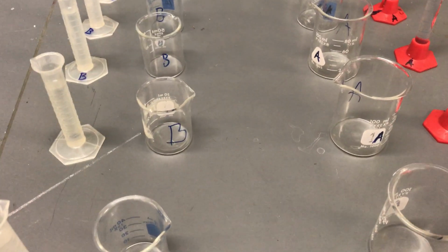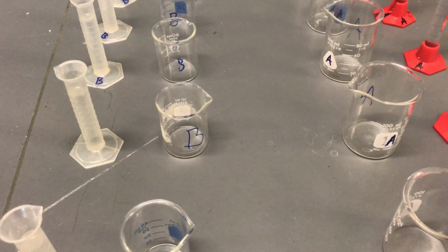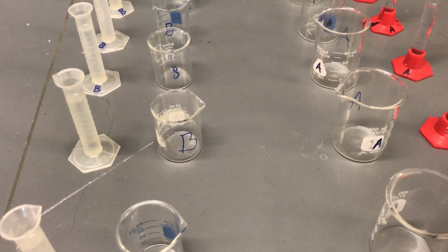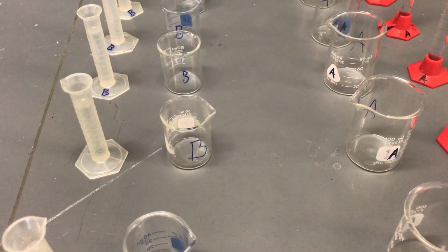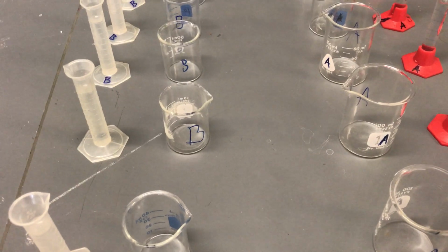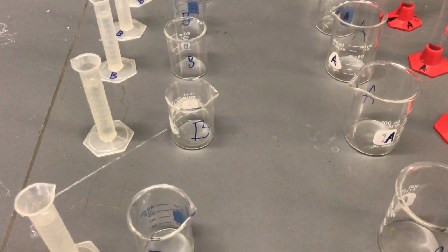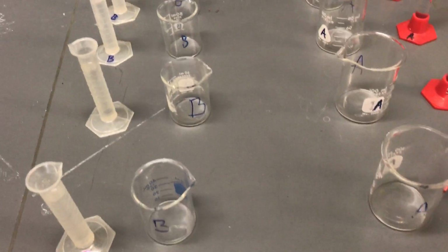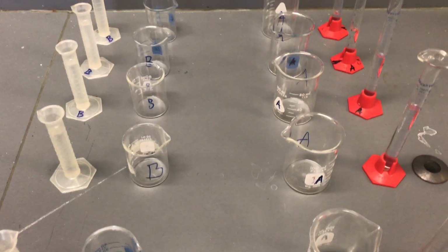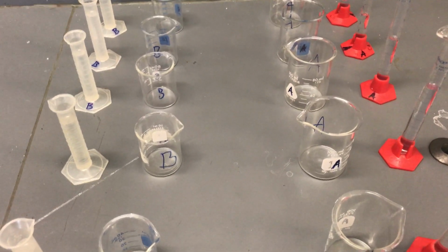Once we pour into the respective beakers, I will add the two together, and what you need to do from your end while you're watching is, as soon as the liquids contact, as soon as you see that first drop contact, you want to start a timer on your phone or a stopwatch, and as soon as you see the change in color, you're going to press stop again. So you're going to do start and stop. Start when you first see the liquid contact, as I pour from B into A, and as soon as you see the color change, press stop. And what we should notice is that there should be some correlated value to help determine what the effect of concentration is on rates of reaction.